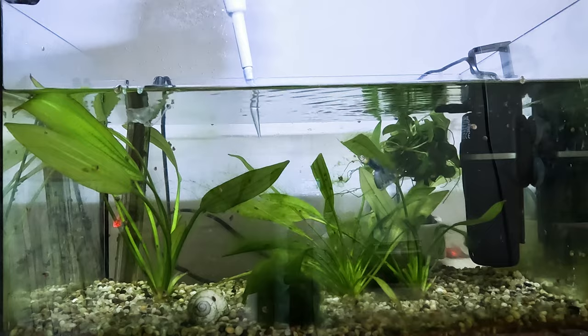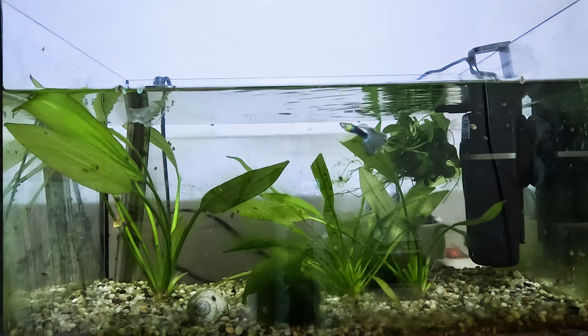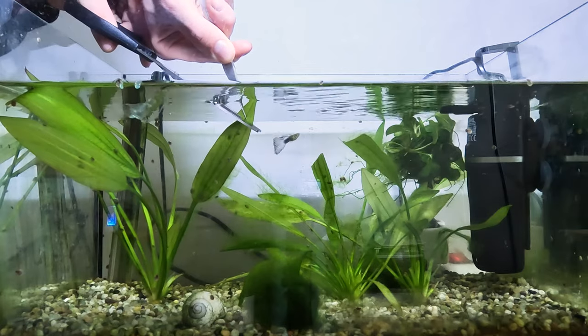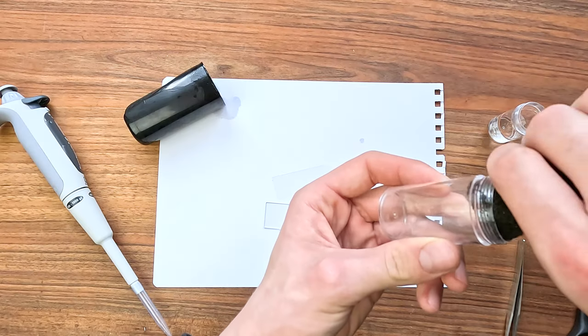Then I also took some aquarium water — I really hope something is alive and moving here. I am taking a smallish sample of one of my plant's leaves. And the last thing I'd really like to check out is the inside of my aquarium filter: I took out the sponge from it and then squeezed it into a vial.